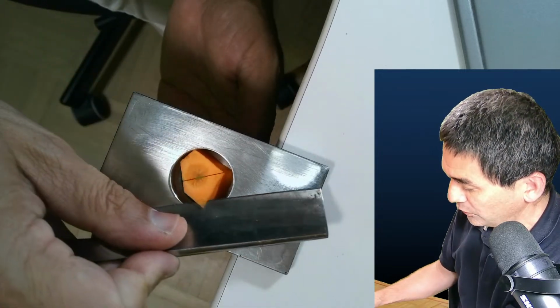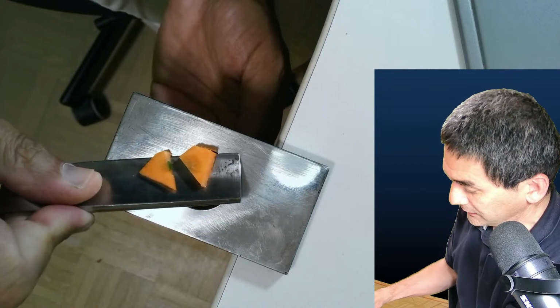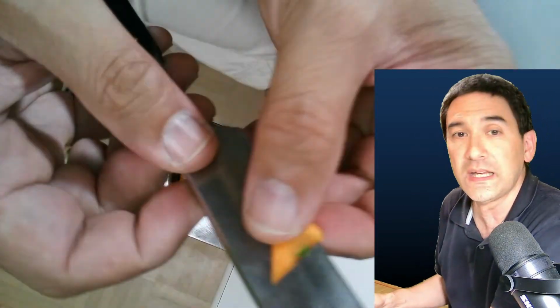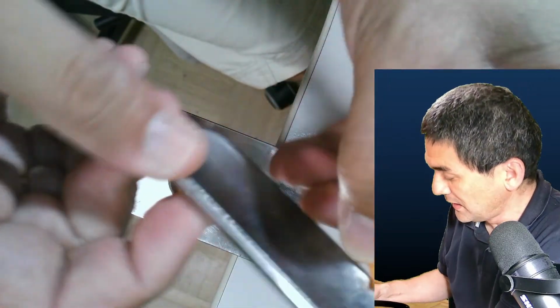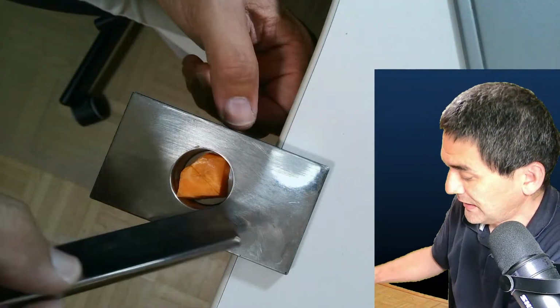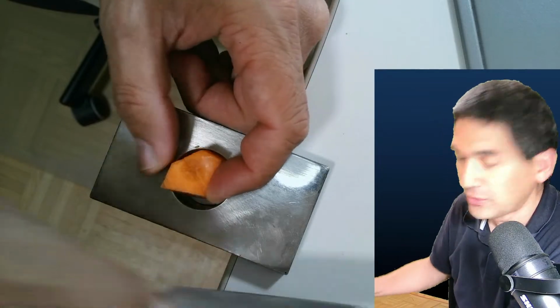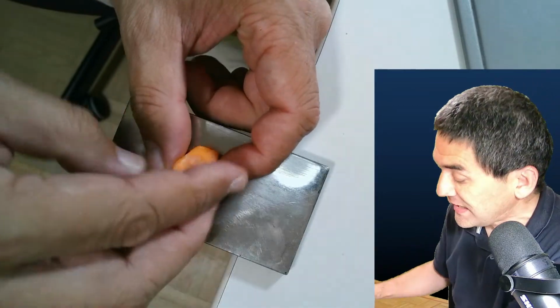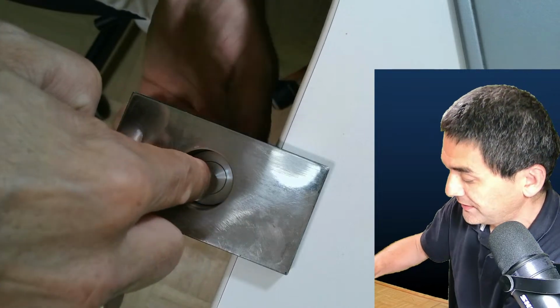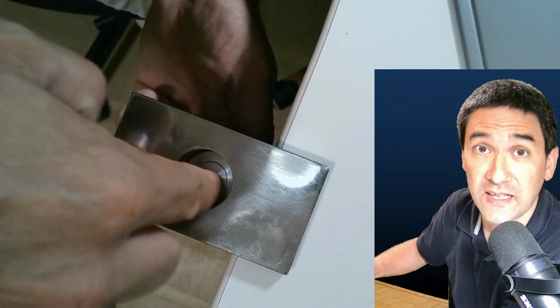Look what happens if you cut it, okay? I know I'm exaggerating right now, but essentially you're getting some kind of a wedge, okay? While you're cutting it, it lifts out the carrot, right? And that is basically not a solution. This is the reason why they're saying you have to firmly press it into the well so that the specimen, or the carrot, is held tightly, okay?